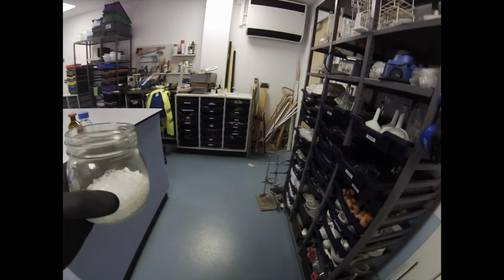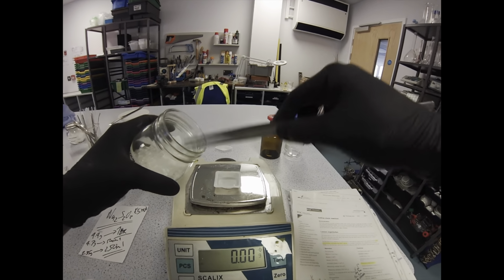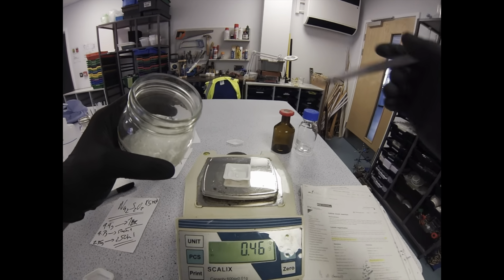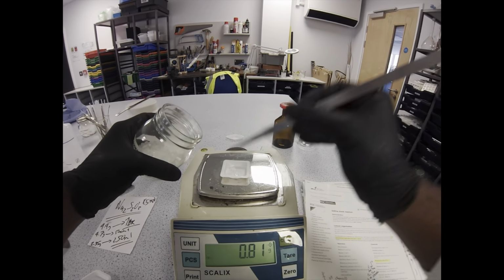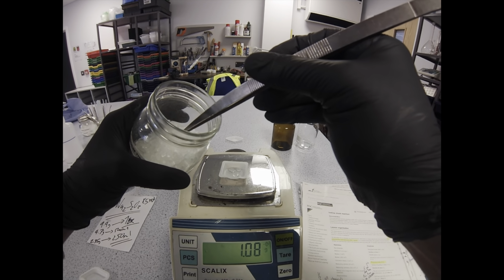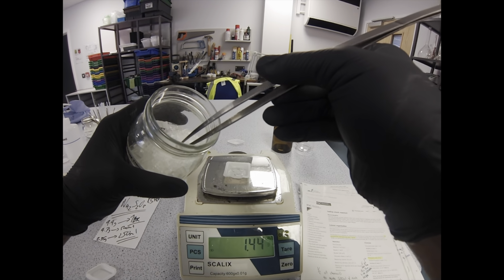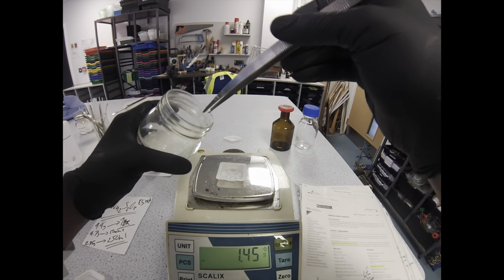Now, next up, we've got sodium thiosulfate, and I like to use forceps for this one because we've got a very coarse crystal. It's been crystallising into these small oblong shapes, and it tends to be easier, especially when you're doing small quantities like this, to use forceps. Right as you get towards the final mass, I'll just select and swap out different size crystals until I get to the mass that I'm after. You can buy sodium thiosulfate as a much finer crystal that's easier to weigh, but I actually like using this really coarse crystal for a different demonstration, for when we're teaching amylase, iodine and starch.